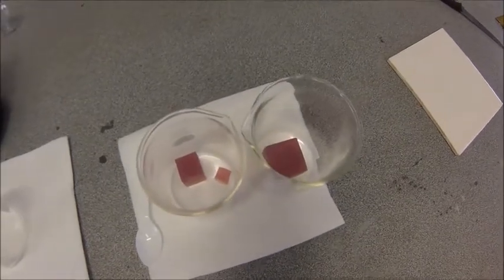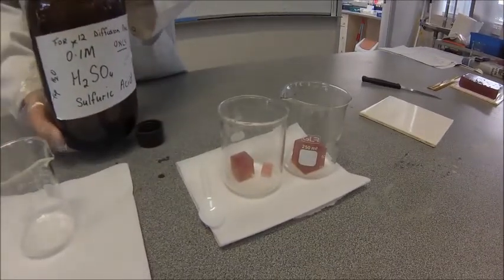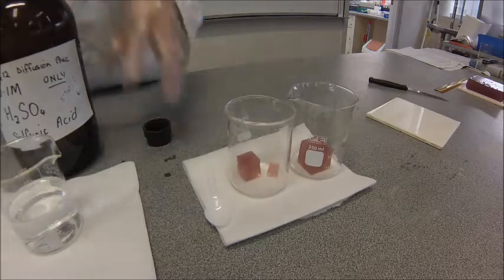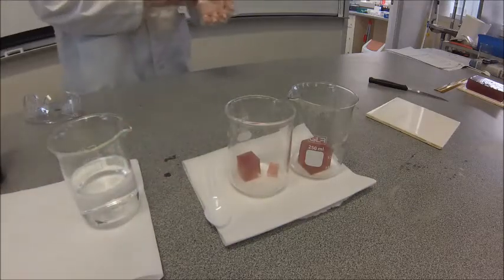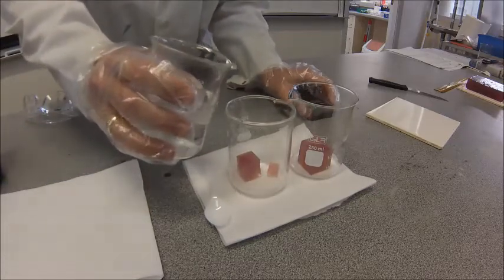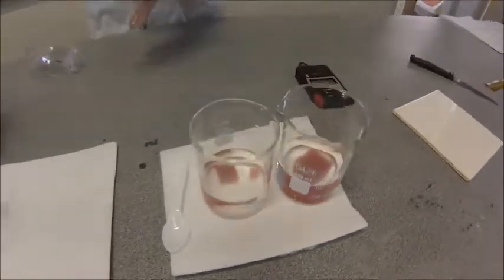Once you have those cubes, transfer them into beakers, keeping them separate from one another. The next step is to add the sulfuric acid — enough to immerse the cubes entirely, but you don't need to fill the beaker all the way. I've got the sulfuric acid here in the Winchester and I'm going to pour it into another beaker to make pouring safer. About 150ml should be enough. Then set your stopwatch, because you need to time how long the cubes are immersed.